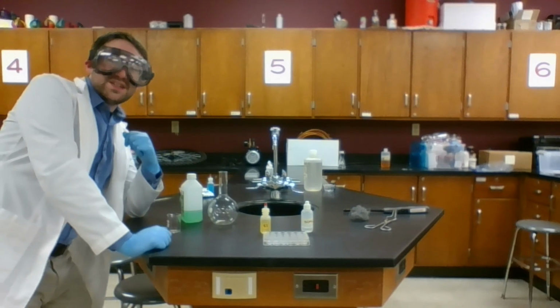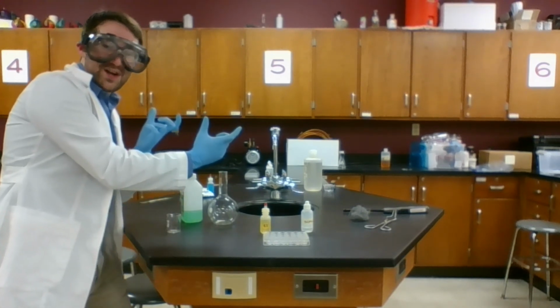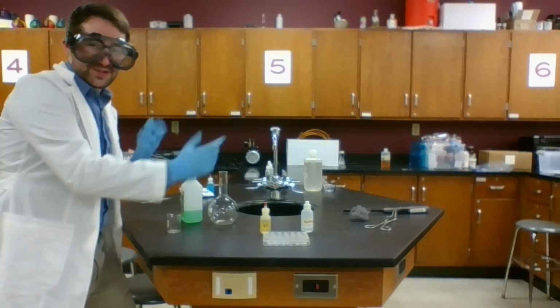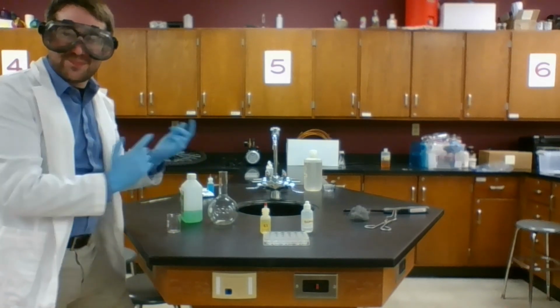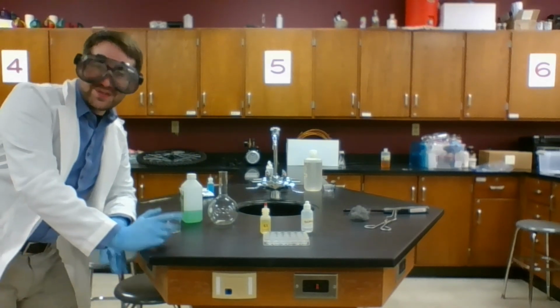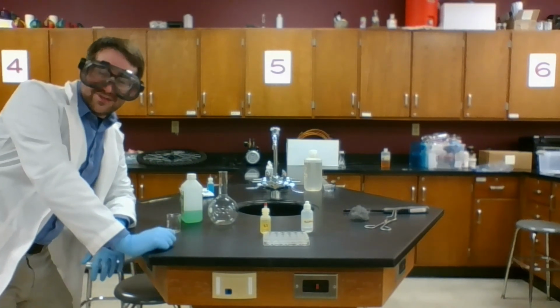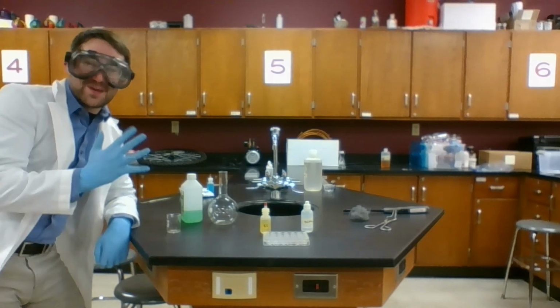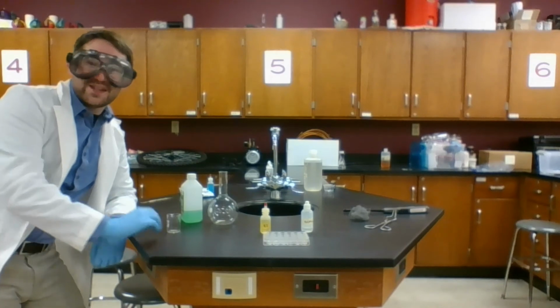And finally, double replacement reactions, where we have 2 couples, 2 compounds that switch partners. So you have new couples going on. You have new compounds, typically by switching ions, like polyatomic ions. So in this lab, we're going to demonstrate a couple different examples of these types of reactions. We have 6 stations, so since there are 5 types of chemical reactions, we're going to see one type of chemical reaction twice.